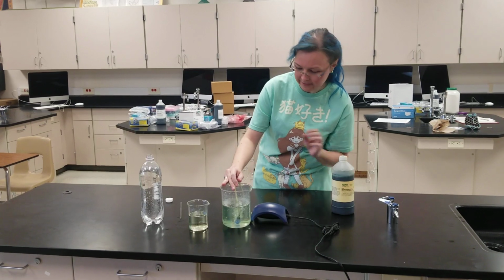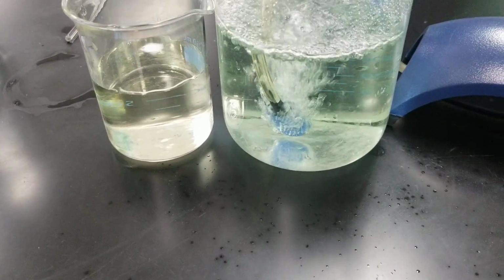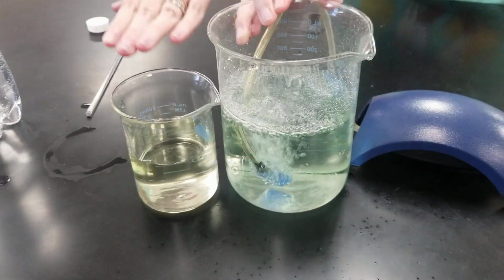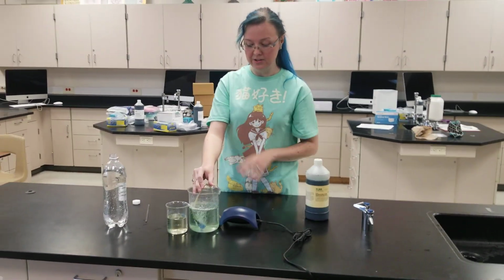So we can already see, if we zoom in a little bit here and we compare it, if we left this for longer, it would probably go right back to that blue color, but we can already see a good difference in the colors changing here. So here's our control over on this side, and over on this side we have the one that's changing back to that color. So we're adding oxygen into it.